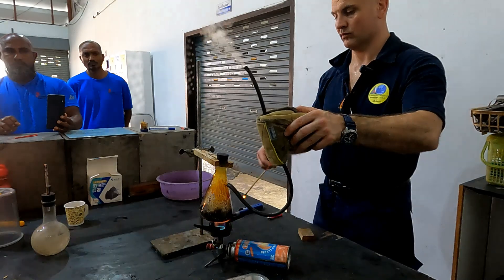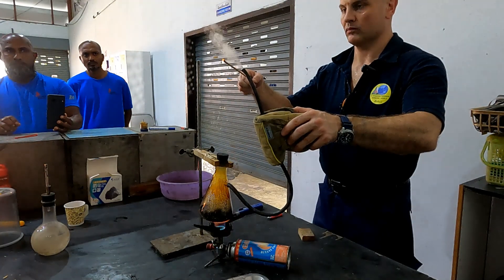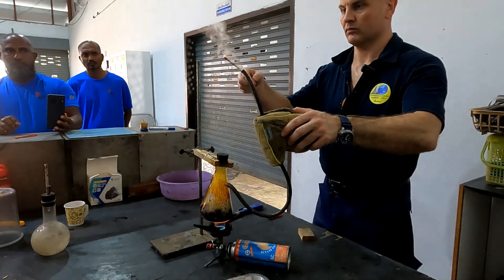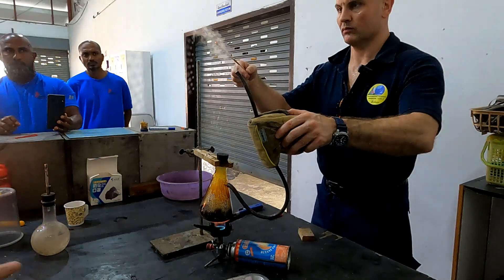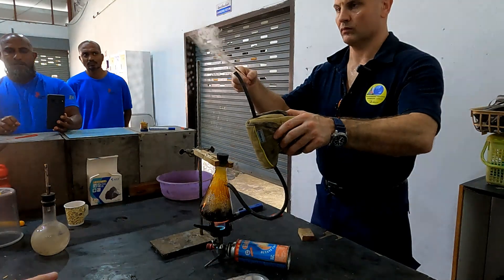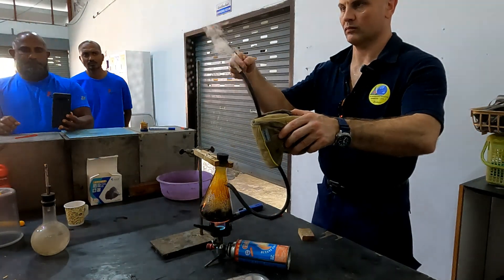The carbon cannot be converted to a liquid, so it's left behind. All we're doing is getting rid of the volatiles.